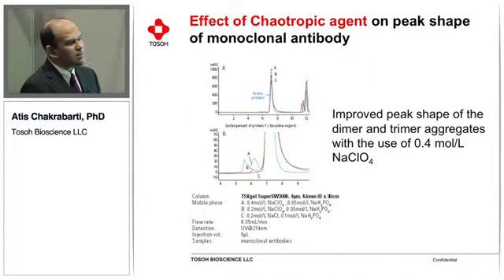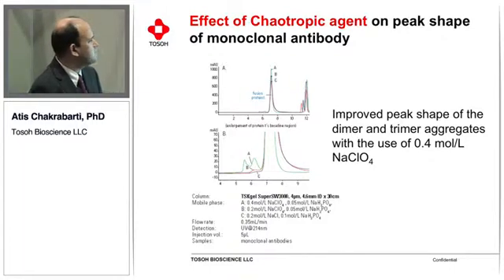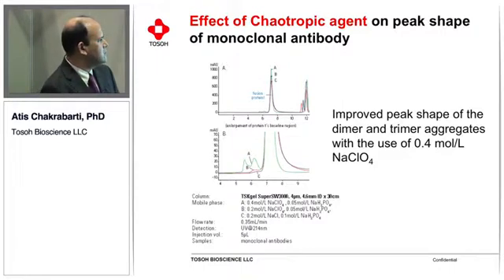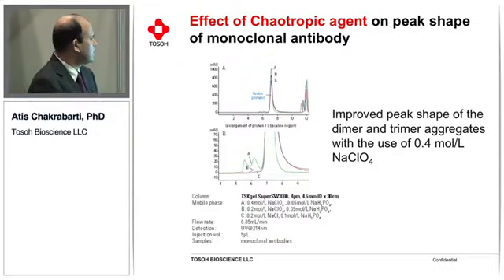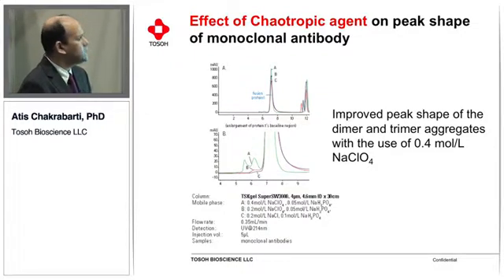Now, what is the chaotropic agent's effect on the separation? In this case we have separated a fusion protein and we have added sodium perchlorate in the buffer, and as you see, when we used 0.4 moles per liter sodium perchlorate in the buffer, the tailing was improved. Follow the green line, which is the separation using 0.4 moles per liter sodium perchlorate. It definitely improved the tailing.